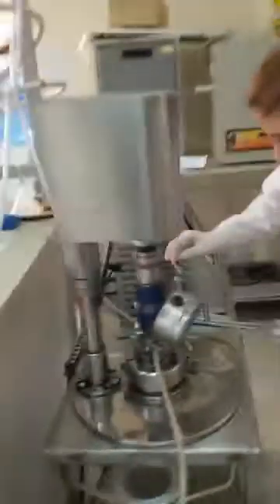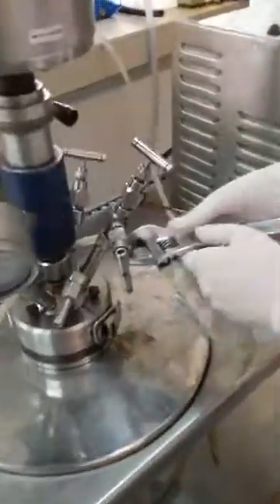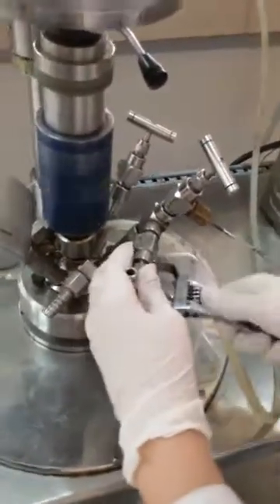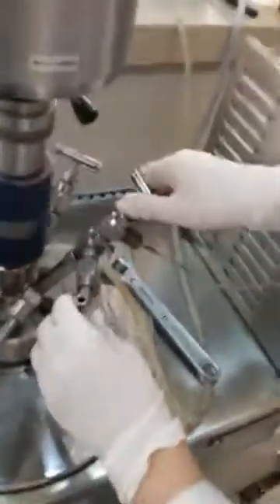To get some samples out of the reaction at different times, you need to close the oxygen flow and open this valve. Now your sample will be withdrawn — just a little bit is enough. Then you need to tighten it back, and open the oxygen flow again.